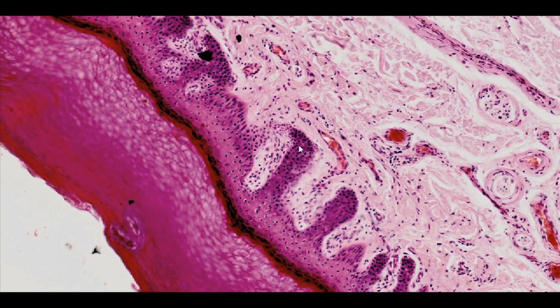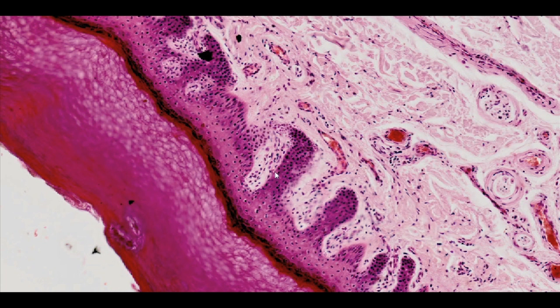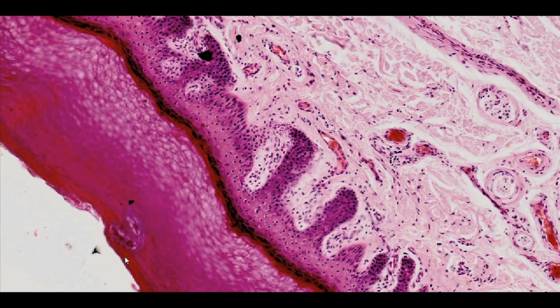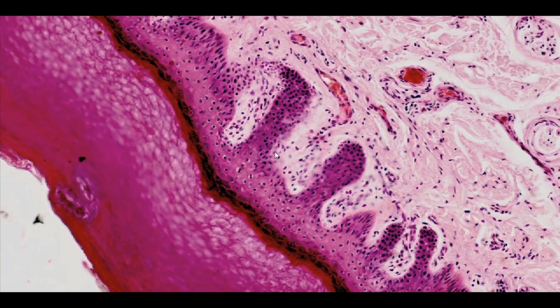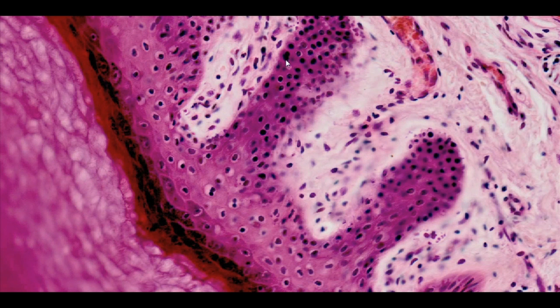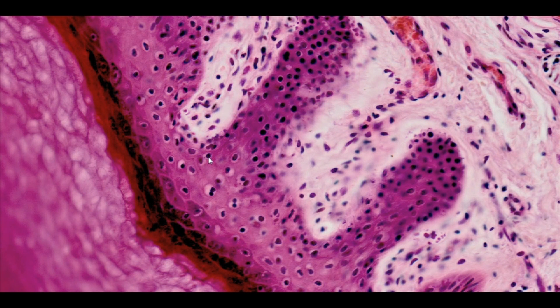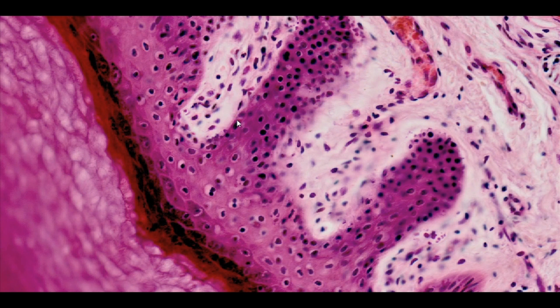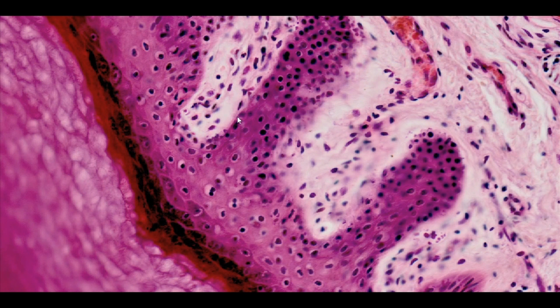Keratinocytes are arranged in several to several dozen layers, forming the stratum basale, stratum spinosum, stratum granulosum, and stratum corneum. The columnar cells in the stratum basale make up only one layer of cells resting on the basement membrane. The capacity to undergo mitotic divisions, which allows for epidermal renewal, is a characteristic feature of this cellular layer. These are therefore stem cells. The cells of the stratum basale are interconnected by junctions, mainly desmosomes, and by hemidesmosomes with the basement membrane.